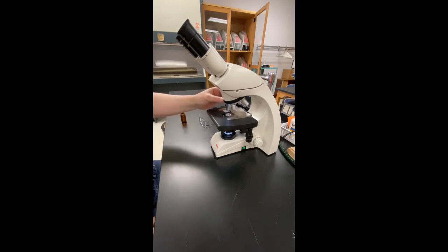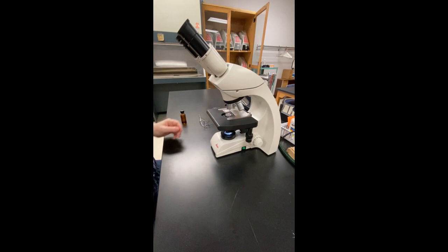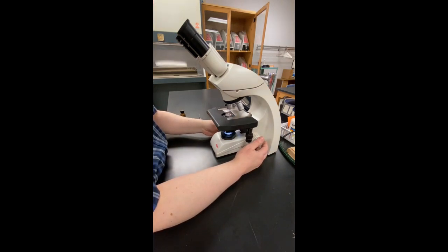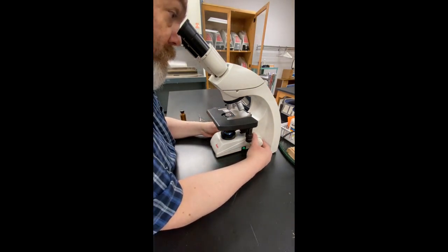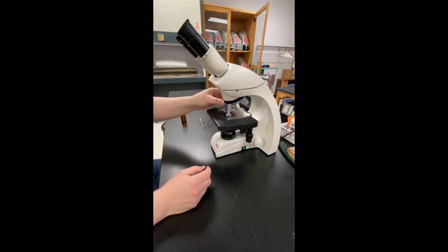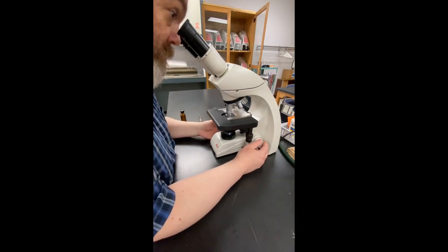If that doesn't work, you can change to the scanning objective lens. Do not place the high-power lens back into position. It will get covered in oil and be difficult to clean. Readjust the focus as best you can, then switch straight back to the oil immersion lens. Turn the fine focus a small amount one way, then the other if necessary, until you find your view. If that doesn't work, you will need to switch to the scanning lens, clean everything, and start from the beginning.